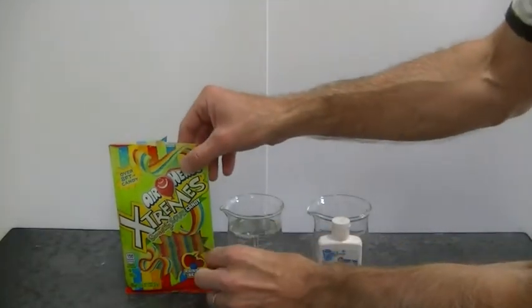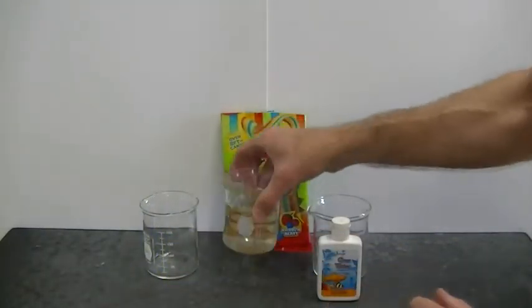We're going to test for the presence of malic acid in this candy in the following way.